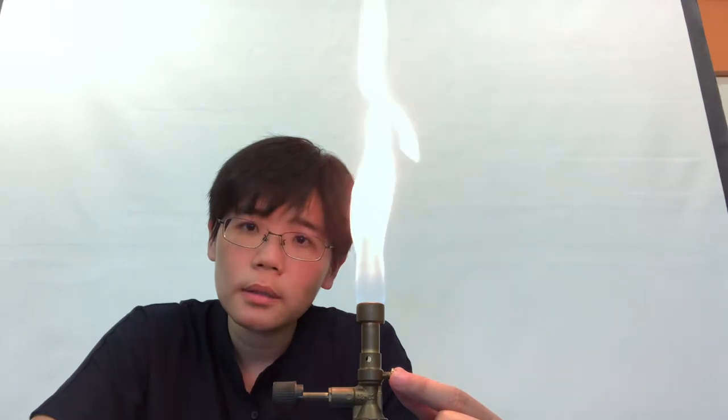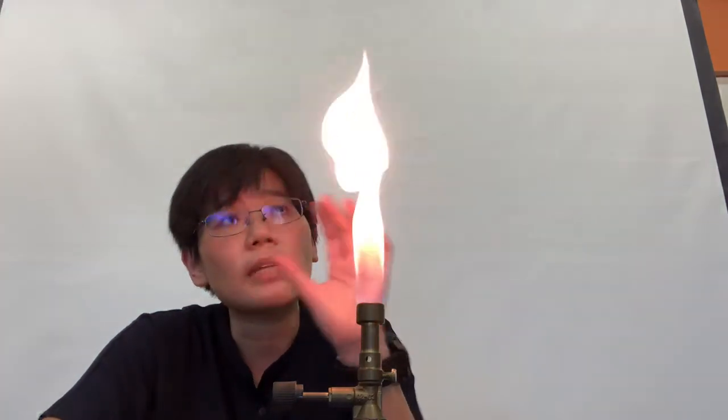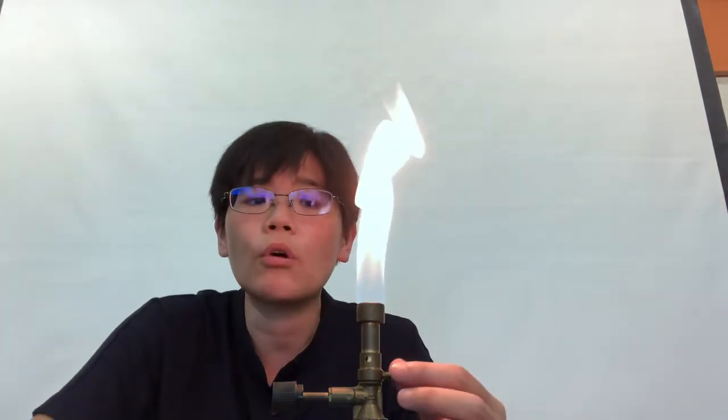How do you do that? You need to adjust the air hole using your forefinger and your thumb. You adjust and move the collar until there is no more black smoke. You don't have to open the air hole completely all the time. You just adjust the air hole to get the size of the fire that you need, to get the type of fire you need.